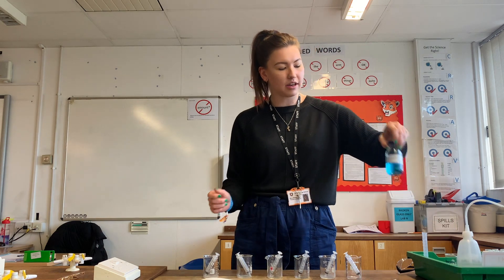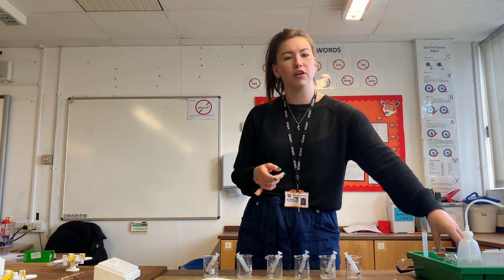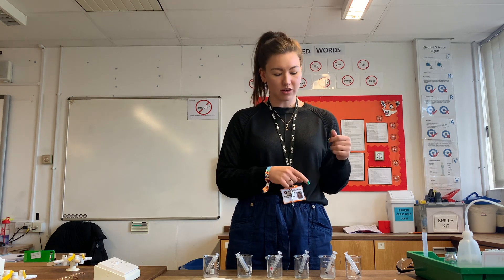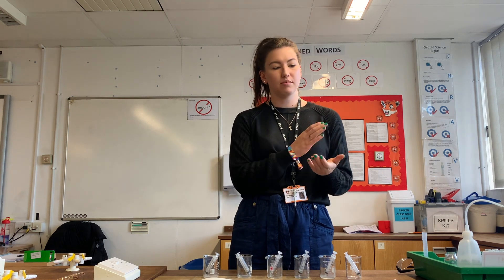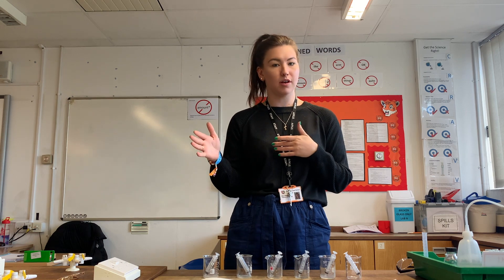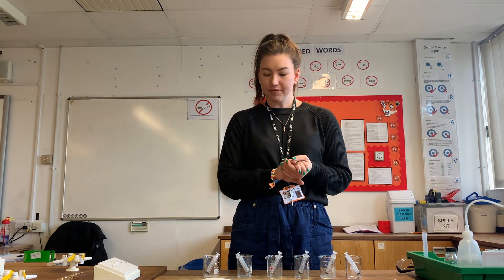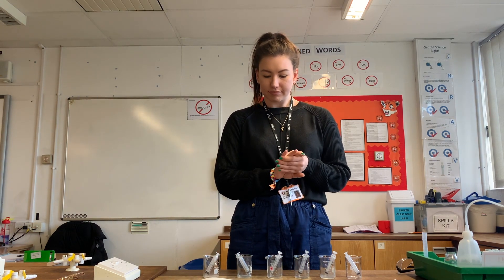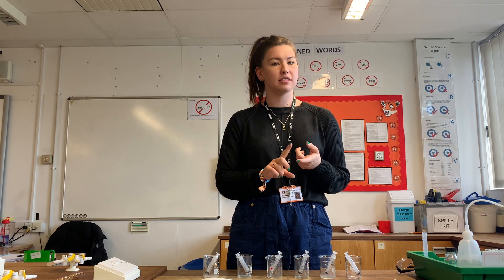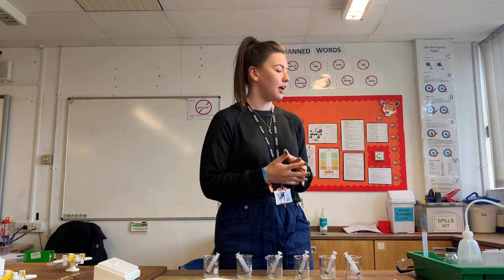The Benedict's solution starts off nice and blue, and then it goes through a color change depending on how much glucose is present - blue all the way through like a reverse rainbow to brick red if there's lots of glucose present. Once we've done that, we'll make the test quantitative rather than just qualitative.